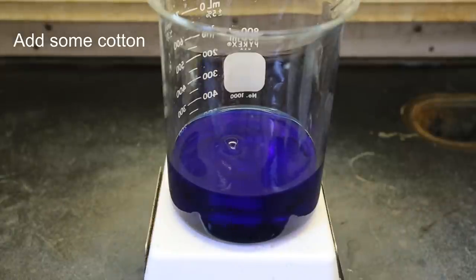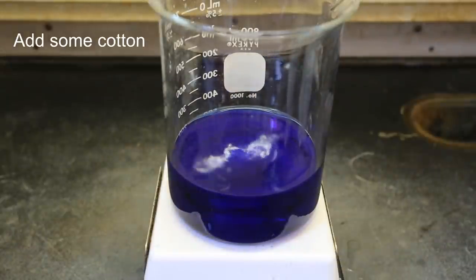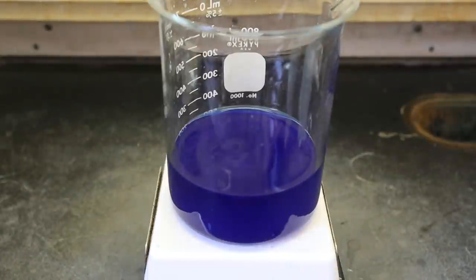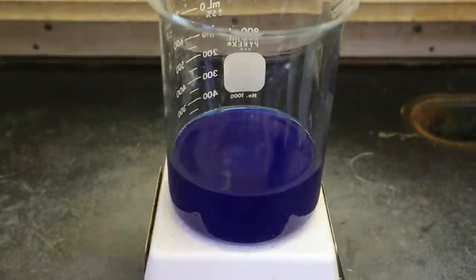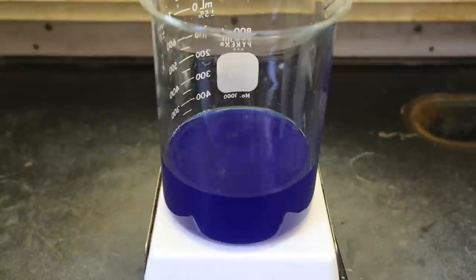Now to test the solution, we add some cotton and see if it dissolves. It does not dissolve cellulose as easy as adding sugar to water, but nonetheless it dissolves cellulose quite well. I simply kept adding cotton until the rate of dissolution slowed down, as this told me it was getting near saturation. This is quite impressive, as only about 3.2 grams of anhydrous copper sulfate would be required to do this.